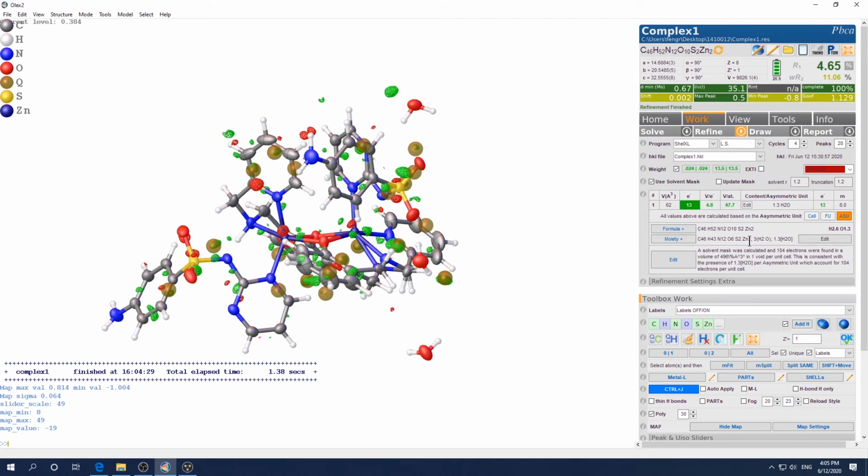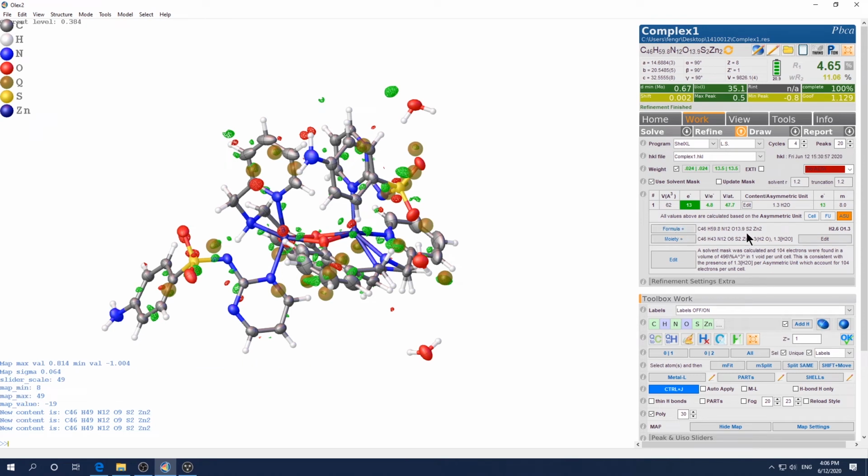Okay, finally, check here. You have to manually click here to add that molecule into this formula. And remember, only click once, because if you click twice, it will add that formula again. Just to show you, if I click one more time, see, that's 2.6. If you click one more time, it's 3.9. So if you end up here, the way to go back is to just click refresh. That will come back here. So now you want to just click once. Okay, so that means it's included in the formula.